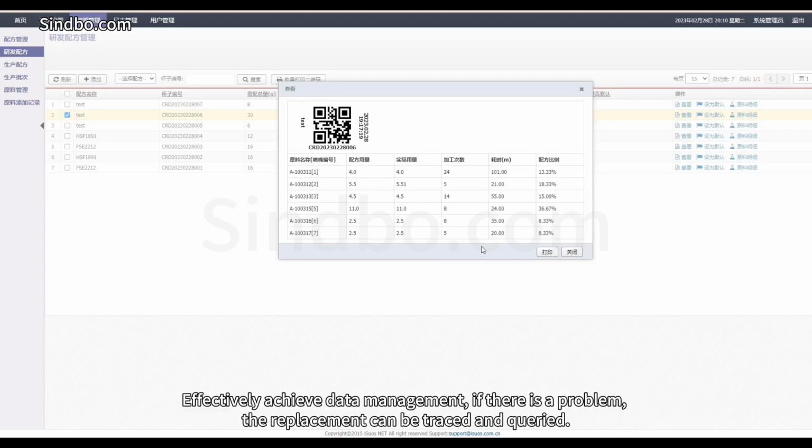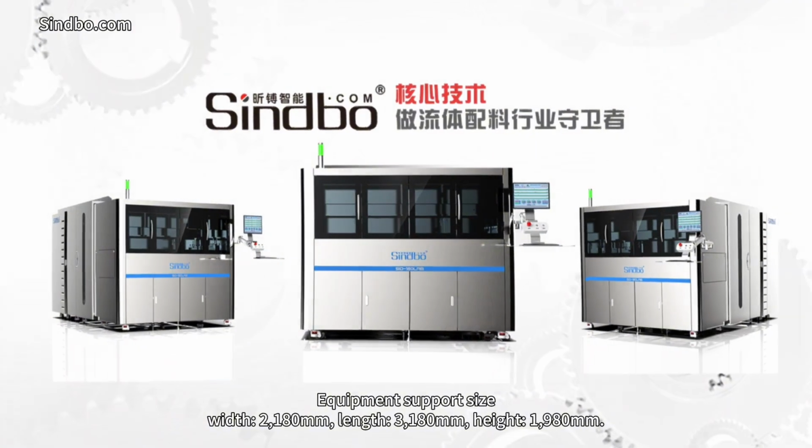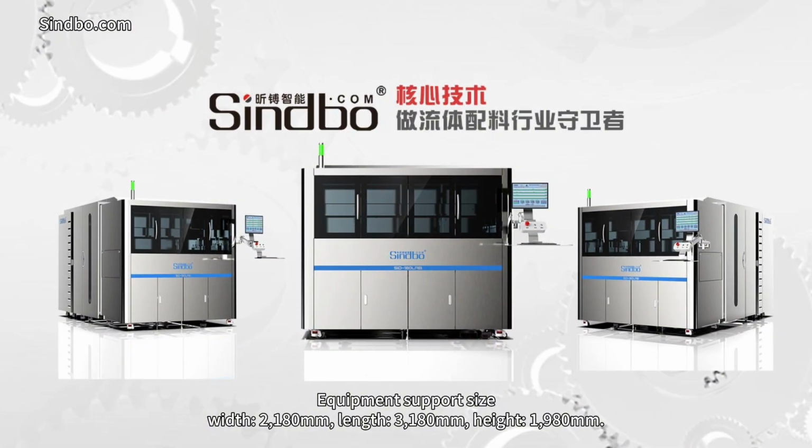Effectively achieve data management. If there is a problem, the replacement can be traced and queried. Device support size, width 2180 mm, length 3180 mm, height 1980 mm.